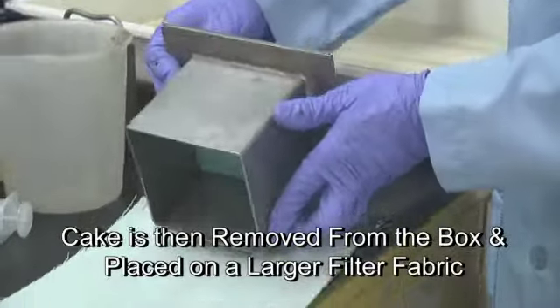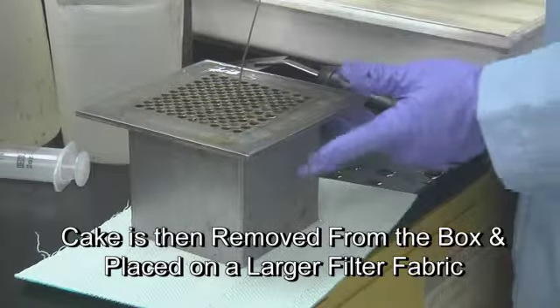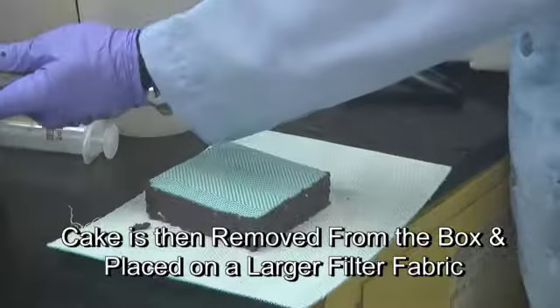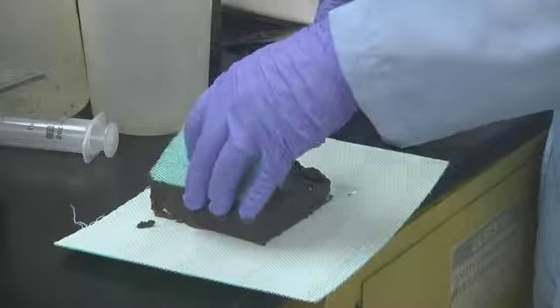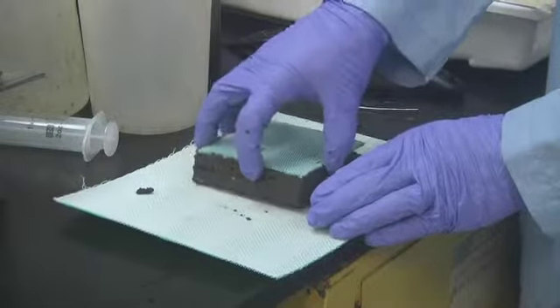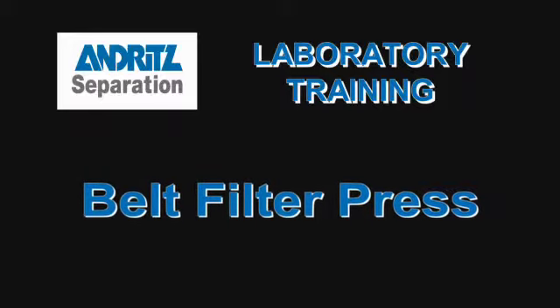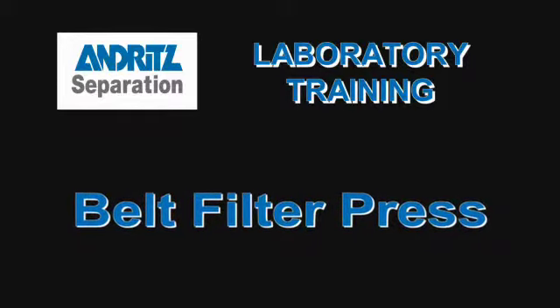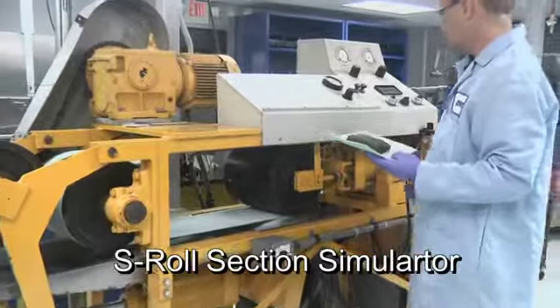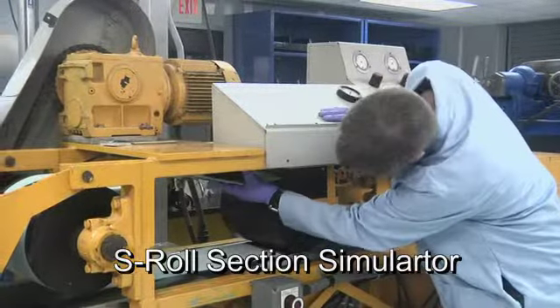The cake is then removed from the box and placed on a larger filter fabric. A cake sample that has been placed on a filter fabric is then placed into the S-roll section simulator.